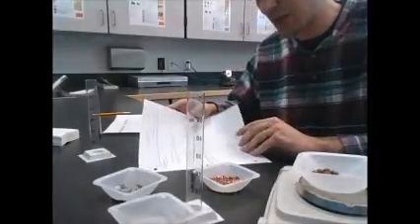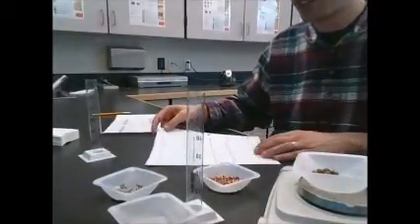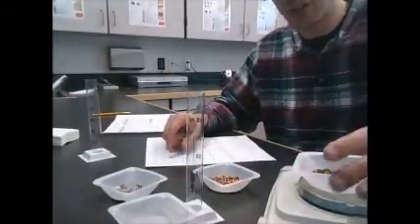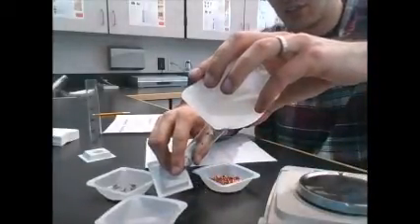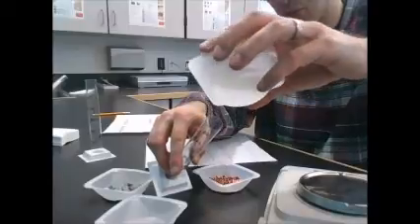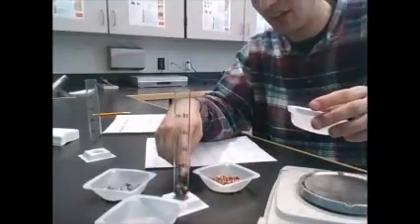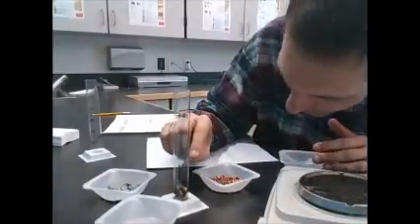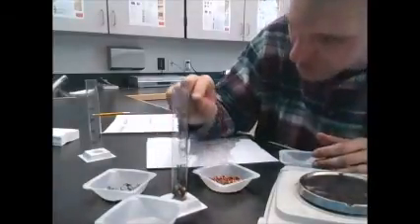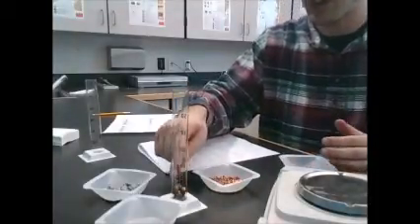I need to record what the volume of water is on my little table on that first sheet. And then I want to add this stuff to it. I need to be careful that when I drop it in there, remember there's water in there too, that water isn't splashing out. That would be a source of error. When I add it, I'm probably going to see a new water level afterwards. So I want to record that one too, where the meniscus is, if there's a meniscus. And the difference in those is going to be the volume of these objects.